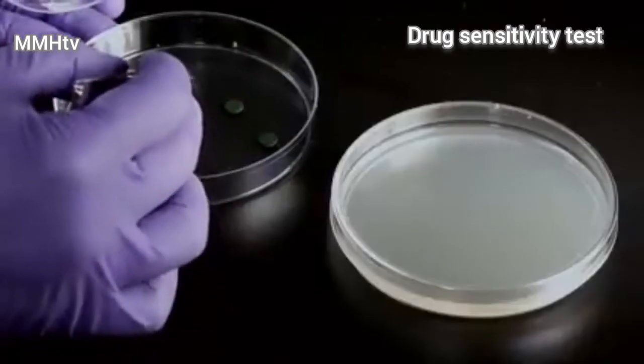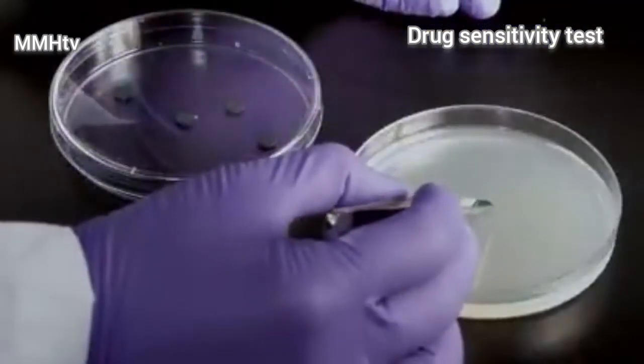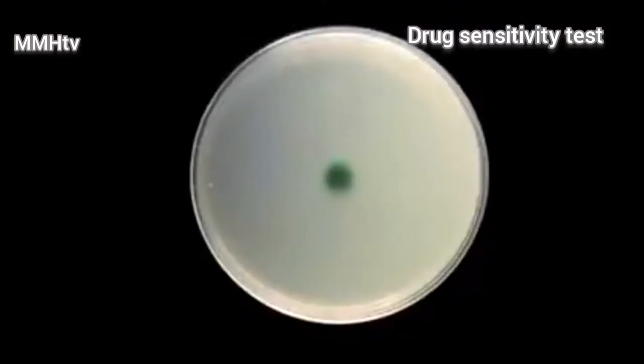The idea is to put a disc that has been soaked in a plant extract on a petri dish containing bacteria culture and see if it will stop bacterial growth around it.